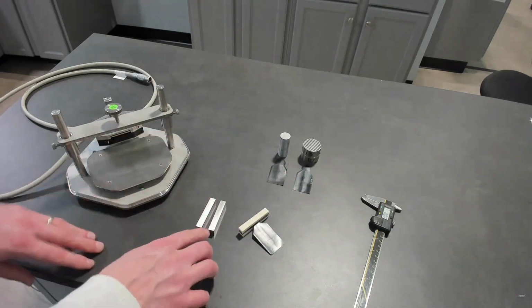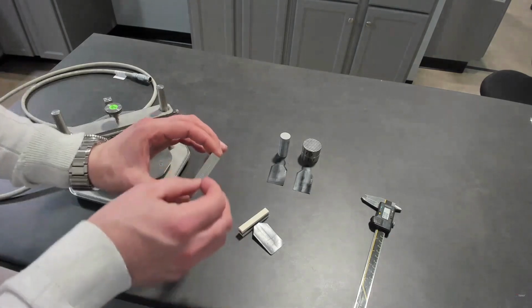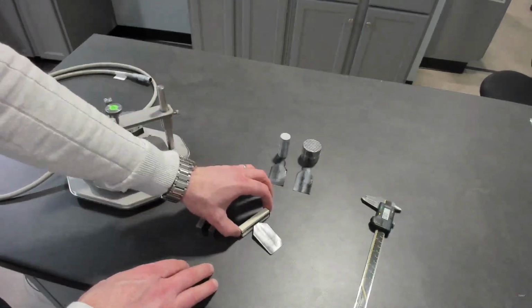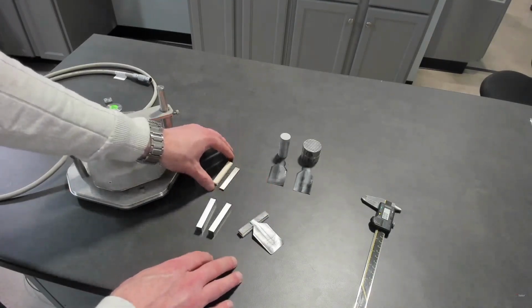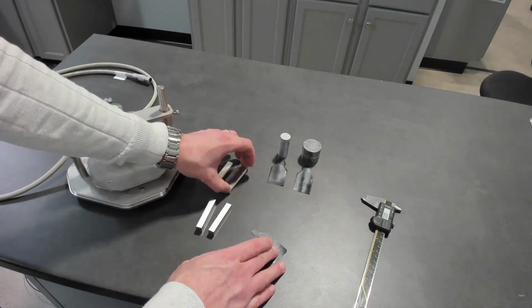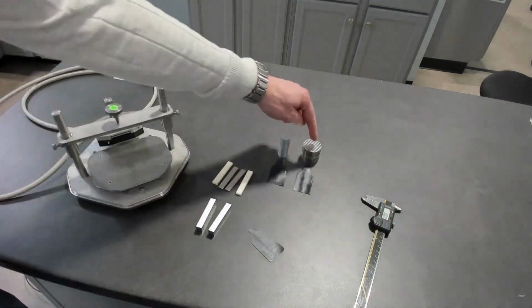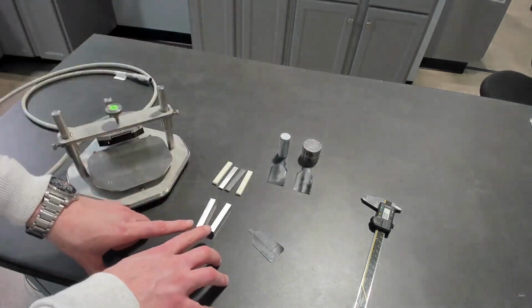So you can do bulk, anisotropic on a bulk sample that has enough thickness. But if you don't have enough thickness, you can run transient hot strip for slab. Those are very specific advantages where, if your sample does not fit well to a three-dimensional shape because you're limited by one dimension, you can run transient hot strip.